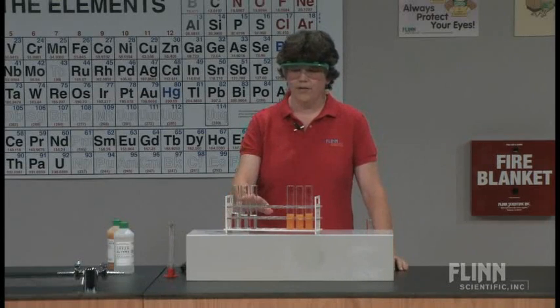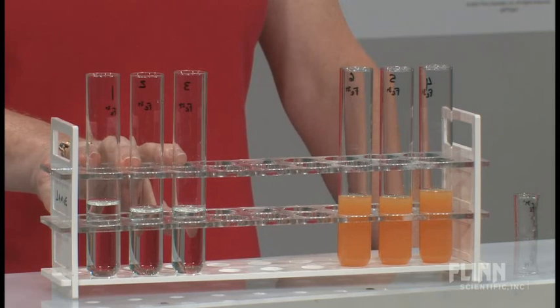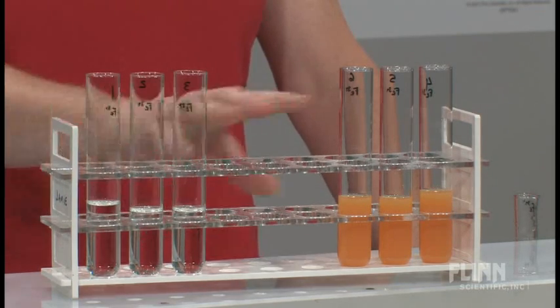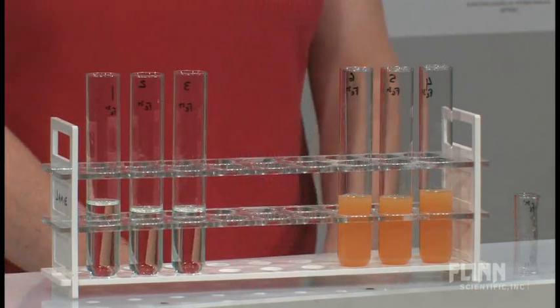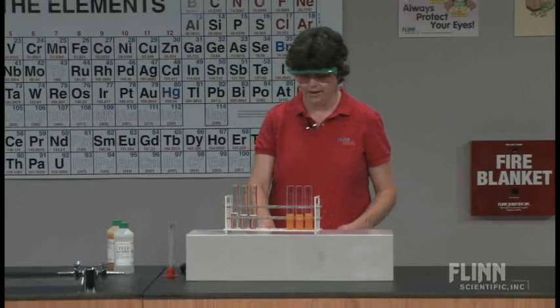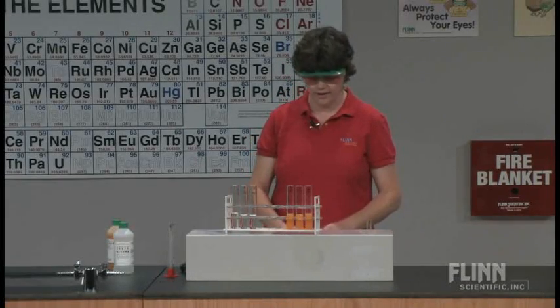What we have here though, if we let this sit long enough, the iron two plus is going to oxidize to iron three plus and we don't want that. So we're going to try to work fairly quickly here. What I'm going to do is I'm going to add some things to complex with the iron ions that are in there.